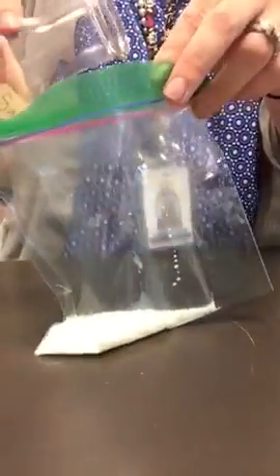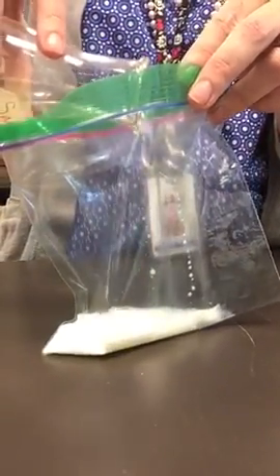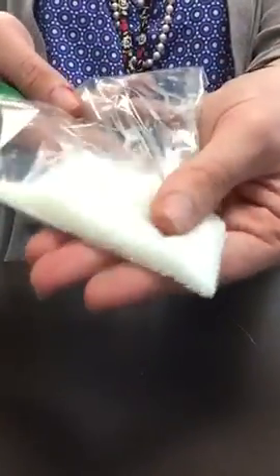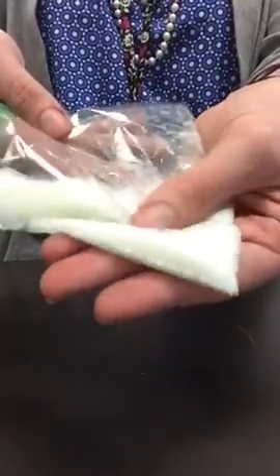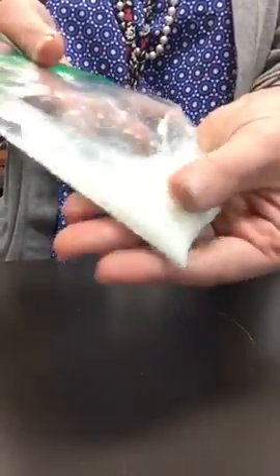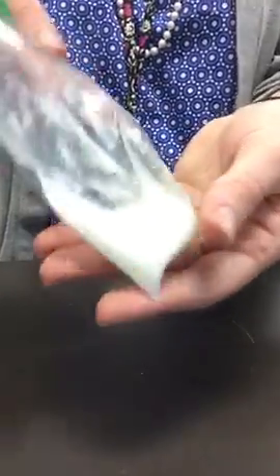All right, now we'll do 2 and 4. So 2 and sample 4, watching for any chemical changes. Getting all the air out. Let's see, that makes even bigger precipitates. You can still kind of see them if that light isn't shining. There's still, if you can kind of tell, some solids that have been created. That means a chemical change happened. 2 liquids reacted to form a solid, a precipitate, and that was samples 2 and 4.